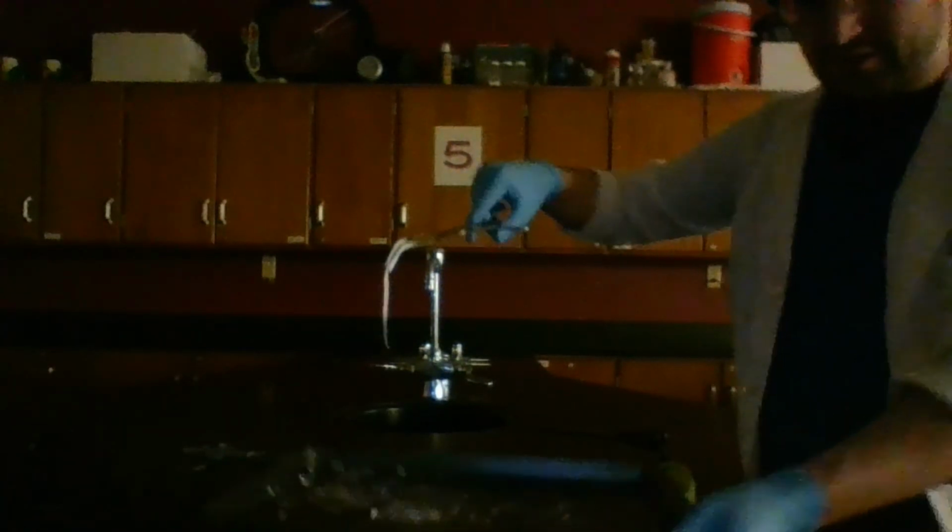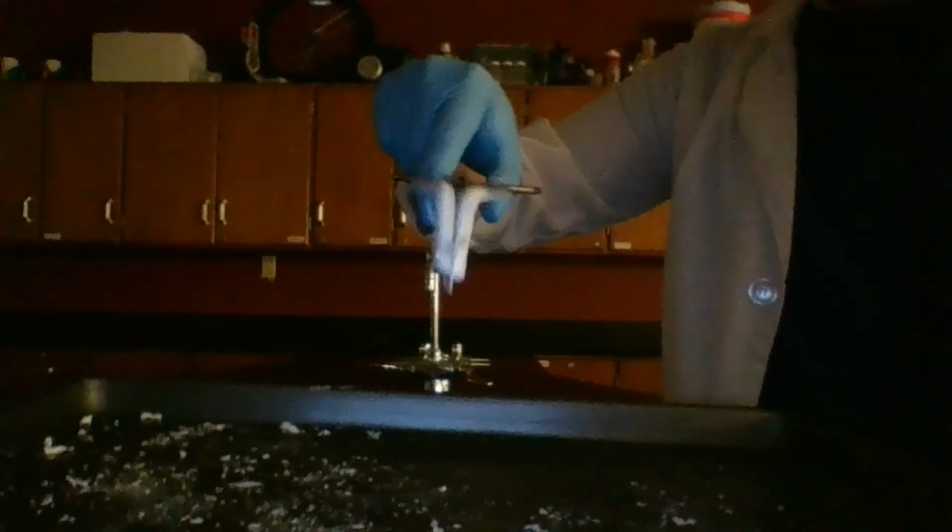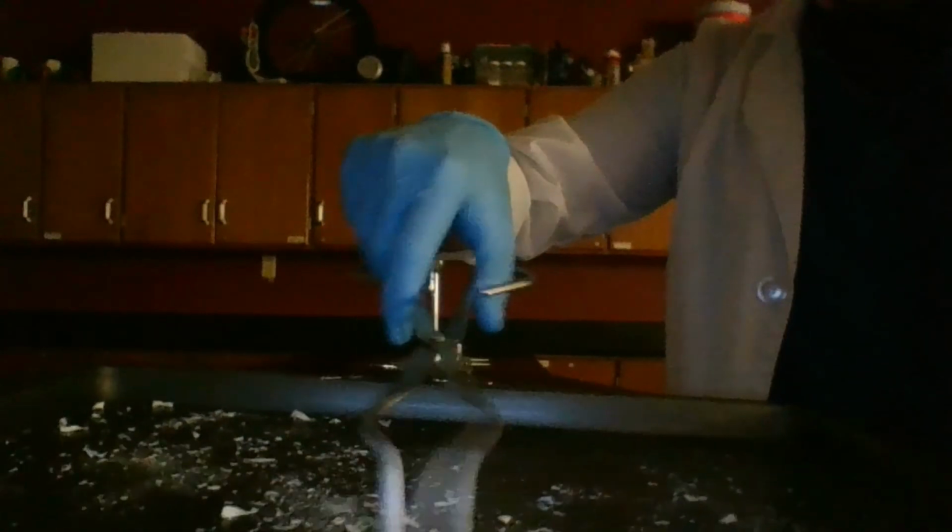Bring this closer. The lights are down, but you might be able to tell this is no longer a gray kind of metal. And if I touch this down here, it just breaks apart. Okay, it's no longer nice and flexible. I've got this white powdery stuff. Okay, and this is a different chemical compound entirely. It looks different. It has different properties.